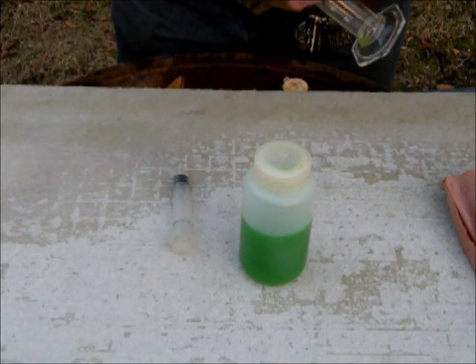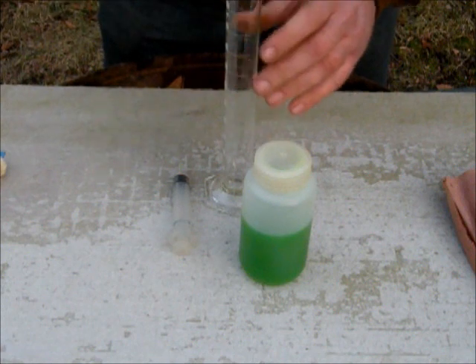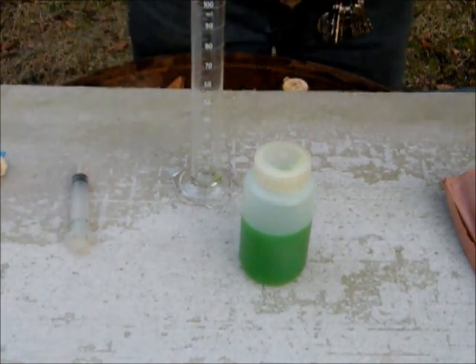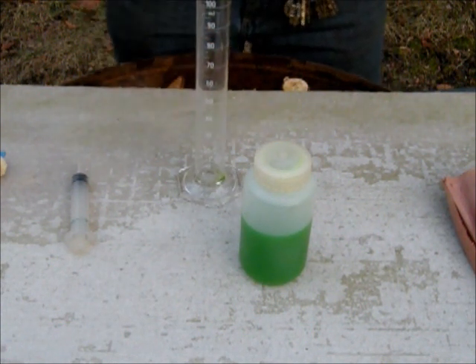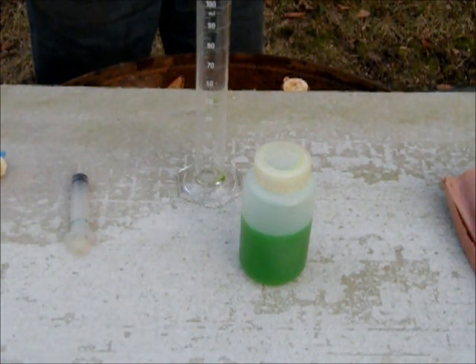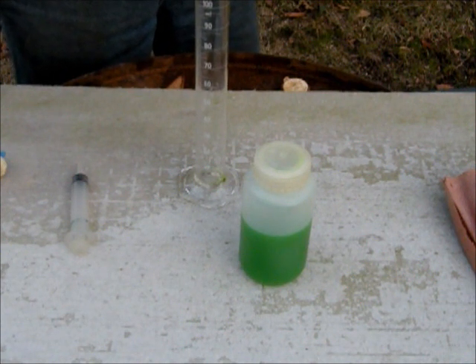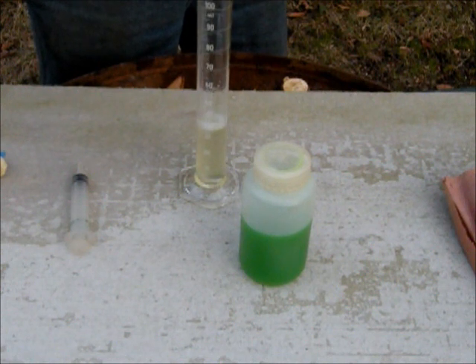The way it goes is you take the stopper out and fill it up to 100 milliliters with gasoline to start off with. This is either 87 or 89, whichever is the lower grade. It should be the 10% ethanol — the one to be tested.